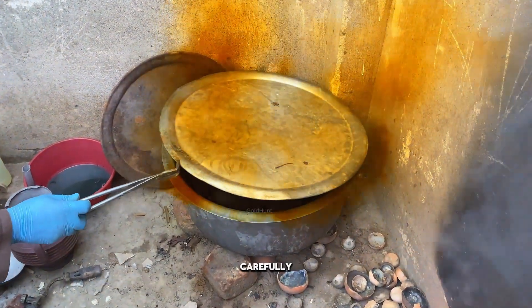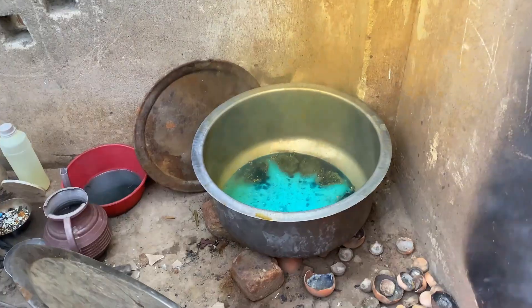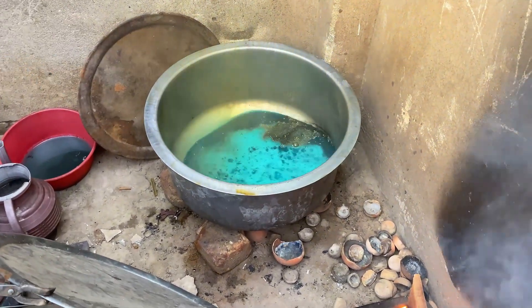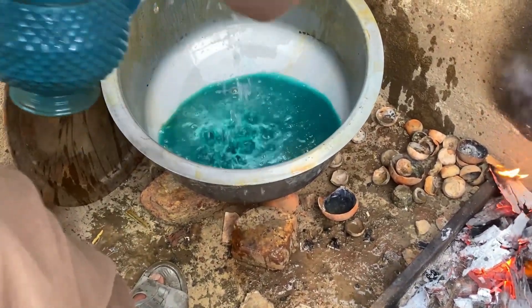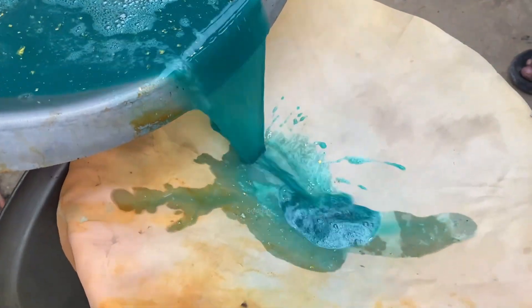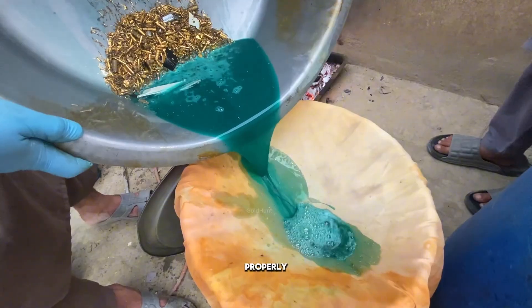When we lift it up carefully, we can see the reaction happening. About 50% of the work is already done. Now we'll add some water to neutralize the acid, and then refresh it through a filter. This filter will help us catch even the smallest pieces of gold. We'll repeat this process two to three times, adding acid, refreshing, and washing it properly.